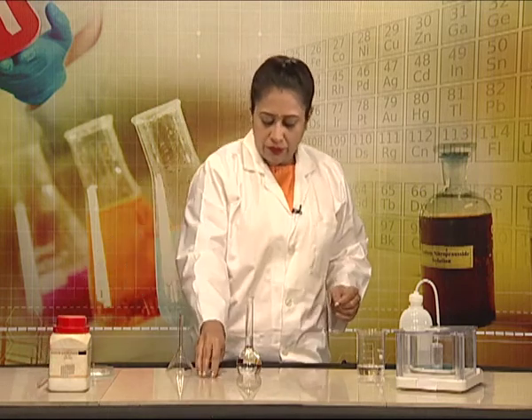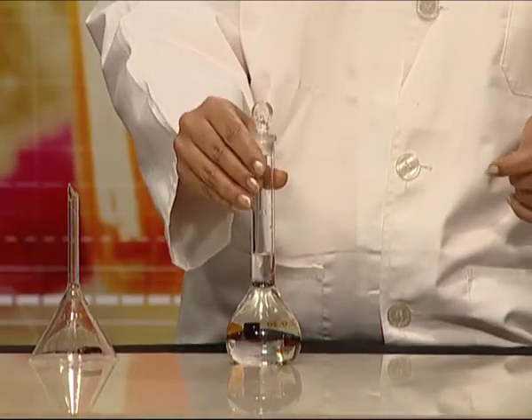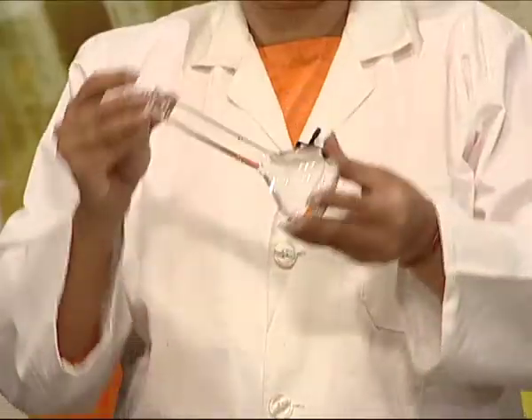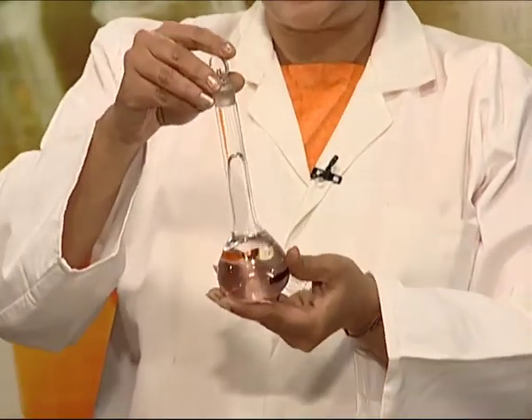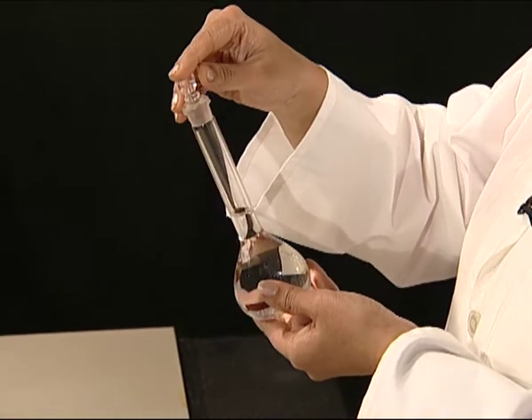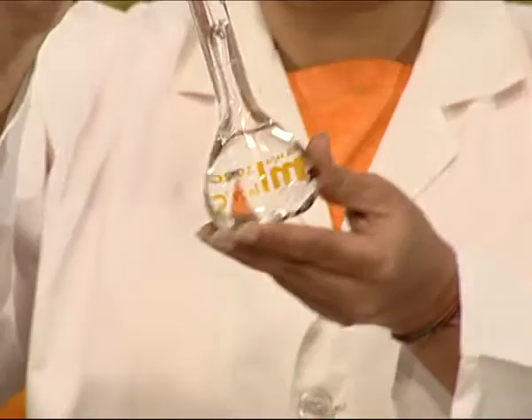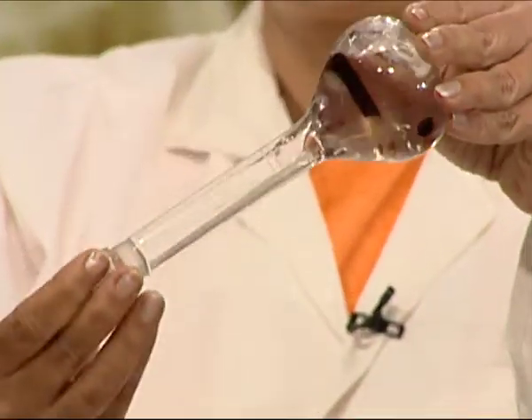We shall now put the stopper on the flask and shake it well, so that a uniform composition 0.05 molar sodium carbonate standard solution is ready for use.